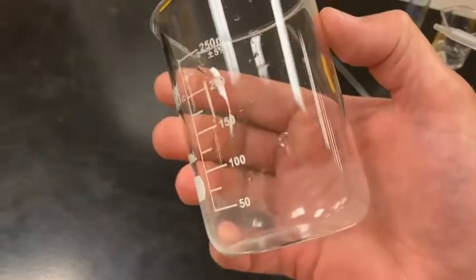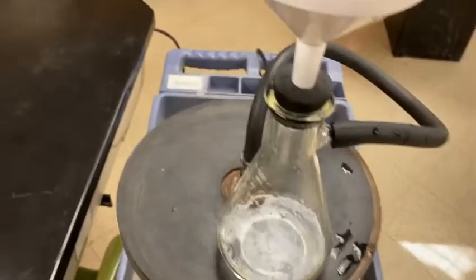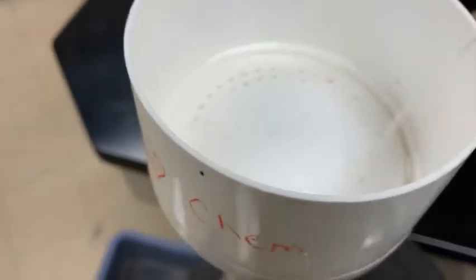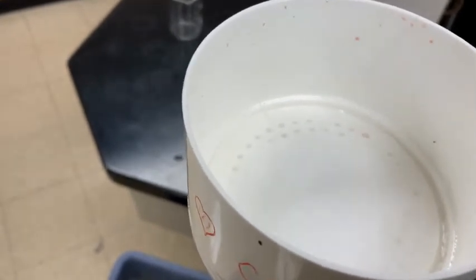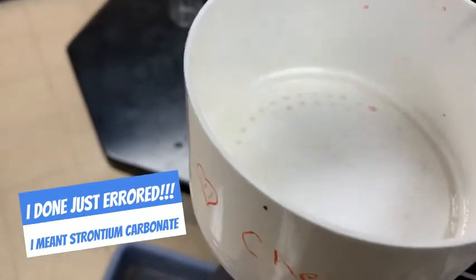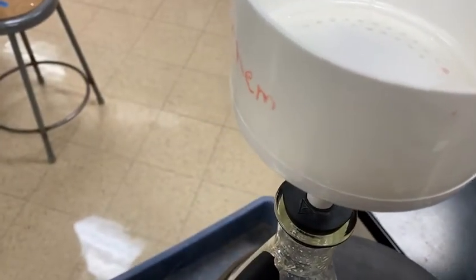Now that my beaker is pretty much clean, the best I could get it, I'm going to take some extra distilled water and wash that precipitate. What the washing does is it gets out all of that sodium chloride and the excess reactant strontium chloride, hopefully leaving just the precipitate, and that's all it is. Okay. Do that a couple times, to ensure that it's a pure precipitate.